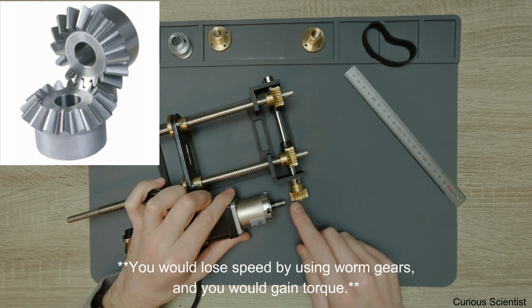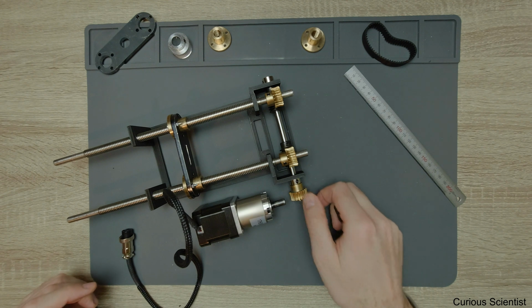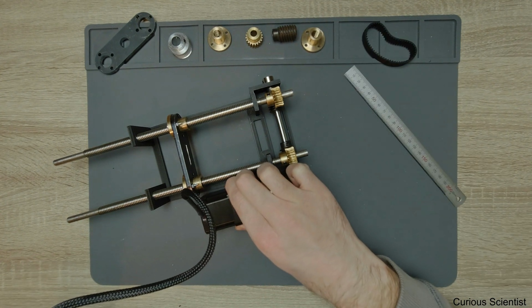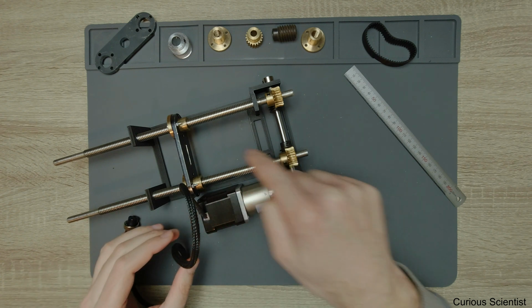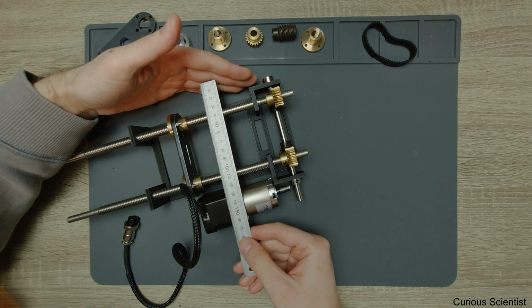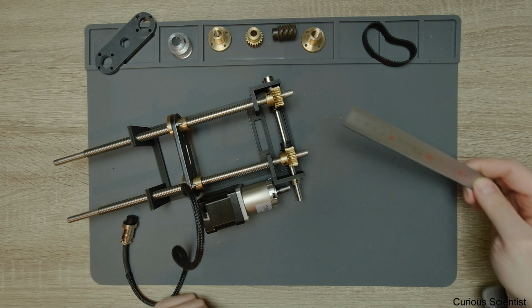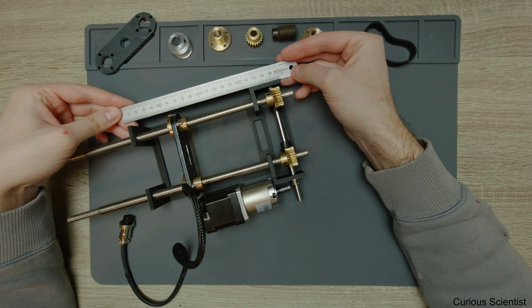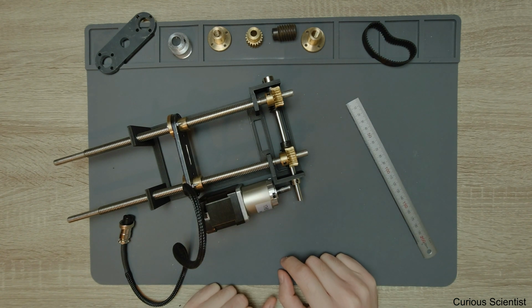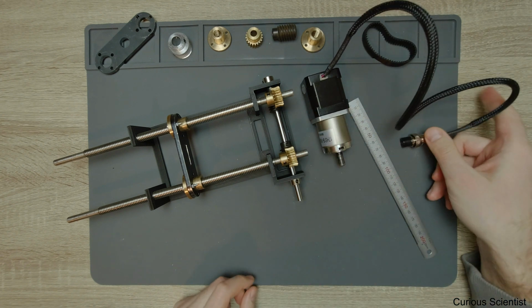But then you have to make sure that you use proper bearings and stuff like that, because then you might meet some thrust along the shafts, and that's not so good. But if you put it like this, like you have the motor parallel to the lead screws, or parallel to the pulling direction, then you increase the width a little bit, so you will have let's say 17 centimeter in width, or 18 centimeter, but then you save some length, so the overall length of this machine will be around 19 centimeters, and that's quite small. So maybe this solution is also worth to consider.